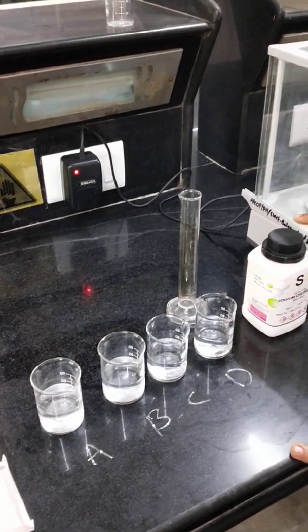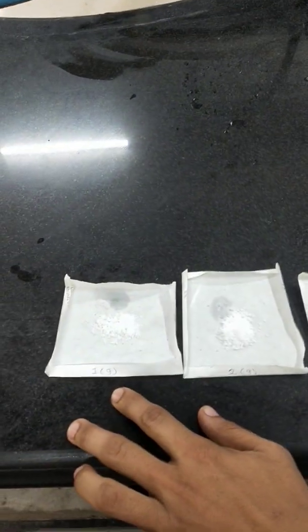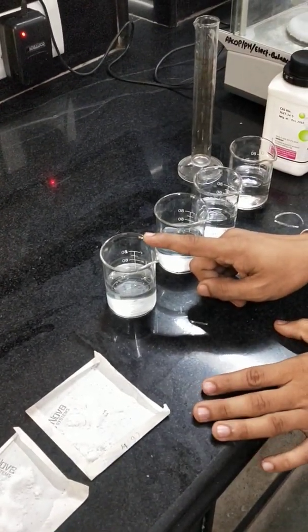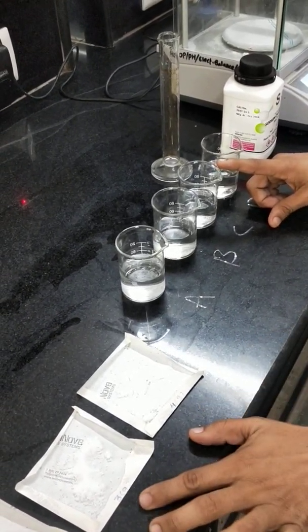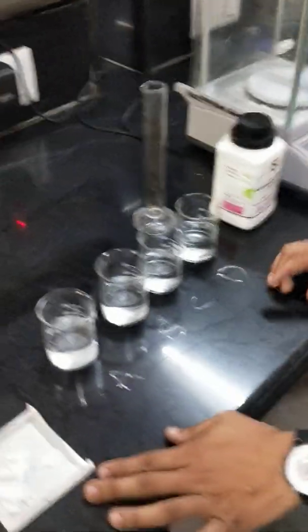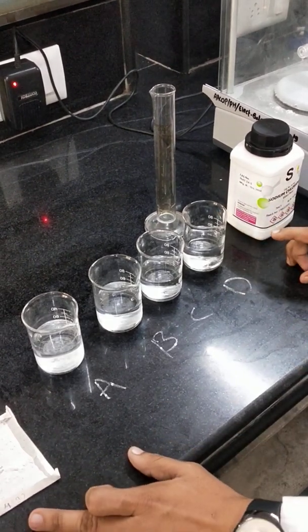The next point is the procedure of this practical. This practical is done using 2%, 4%, 6%, or 8% weight by volume sodium chloride solutions. For 2% solution: dissolve 1 gram sodium chloride in 50 ml water. For 4%: dissolve 2 grams in 50 ml. For 6%: dissolve 3 grams in 50 ml. For 8%: dissolve 4 grams in 50 ml water.